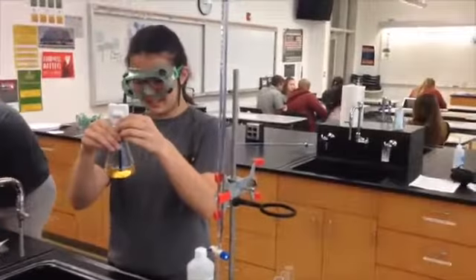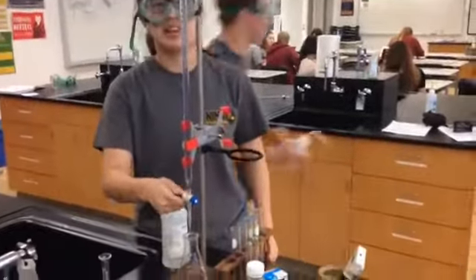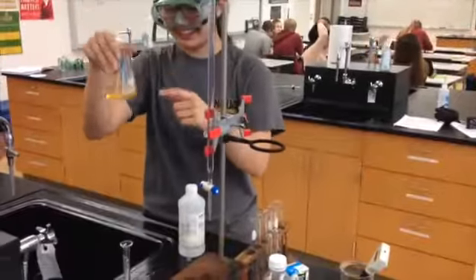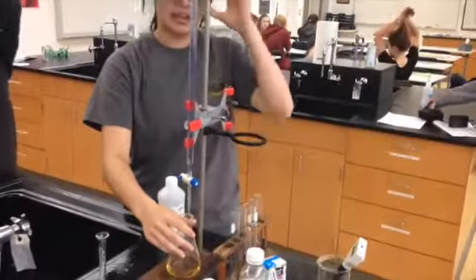Eventually, you'll start nearing the equivalence point of the titration. You'll be able to tell when this happens because the color change of the solution will persist for longer before returning to normal.